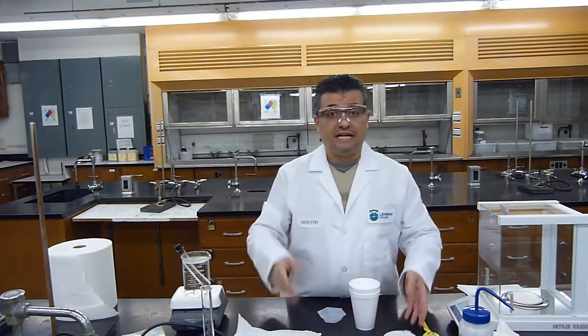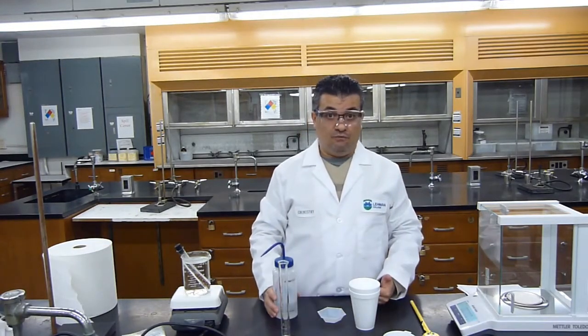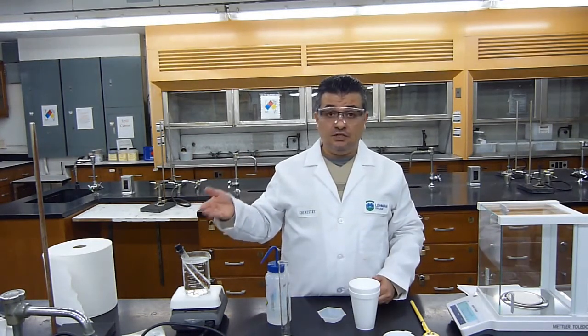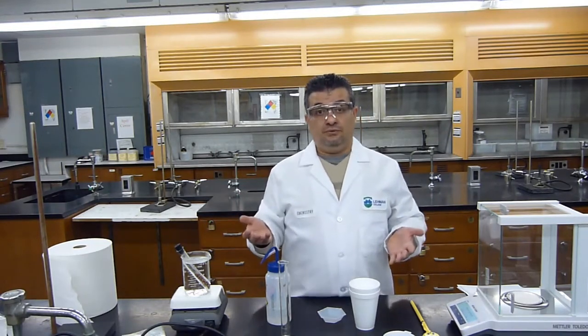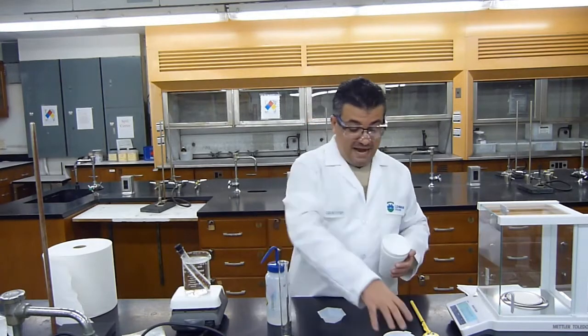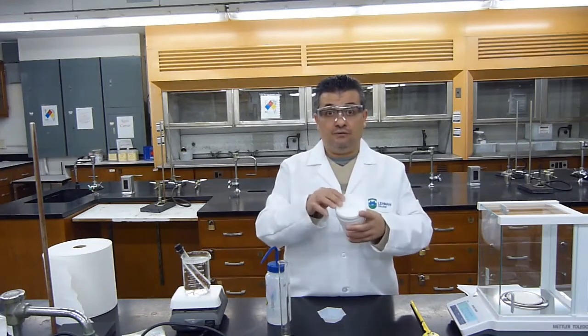And now I could do the second trial, repeat everything over again for the second trial, but now instead of using 40 mLs of water, I will use 50 mLs of water, okay? Now the mass of the test tube, empty, should remain the same. The mass of the metal and the test tube should remain the same because I didn't lose any metal. So the initial mass that I measured in the first trial will remain the same. The mass of the empty calorimeter, okay, again, will remain constant, will not change.